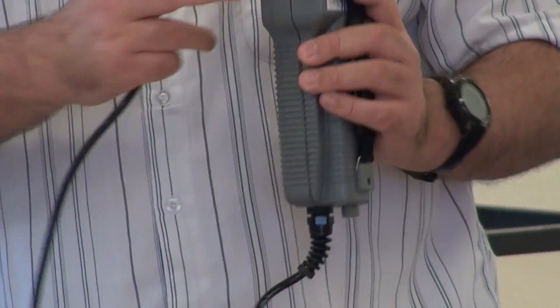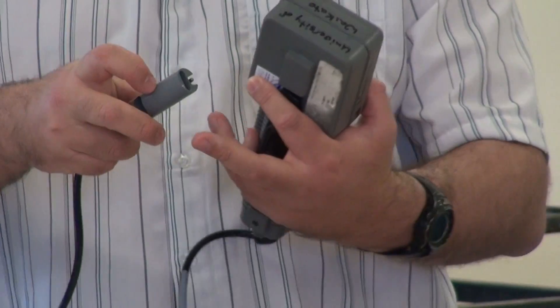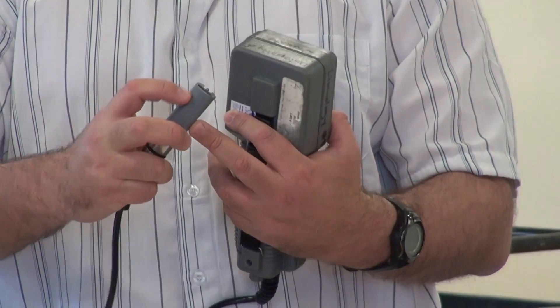Again, the probe is just kept in here. You don't have to worry about it being too damp because the actual measuring center is actually inside here.